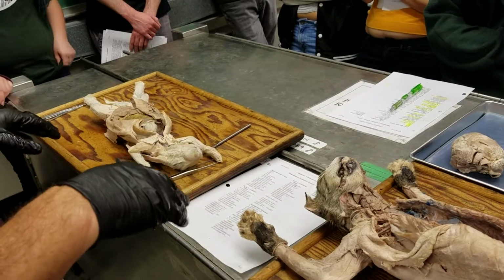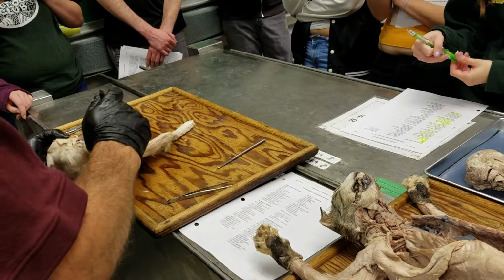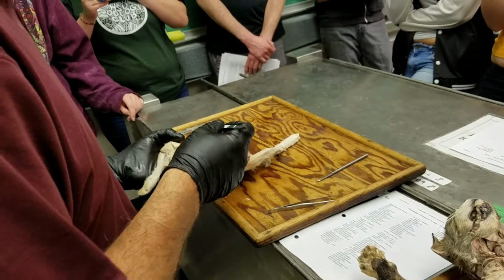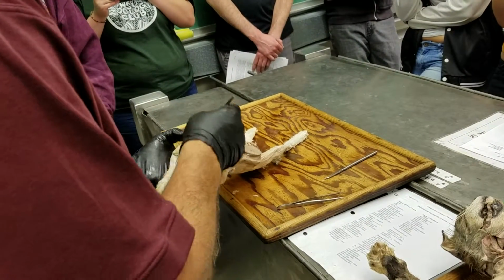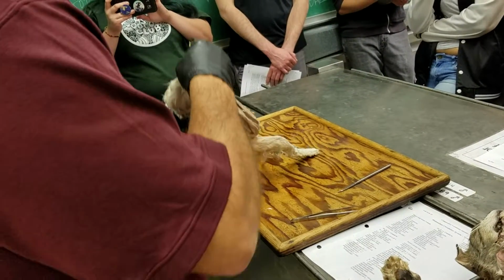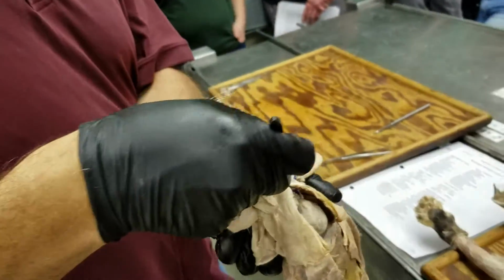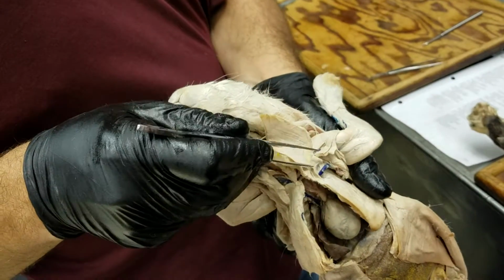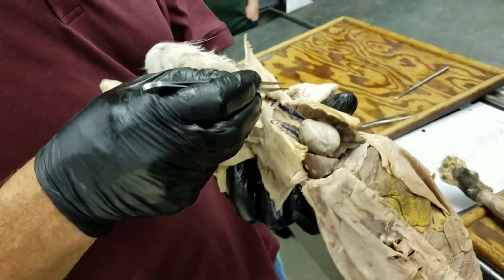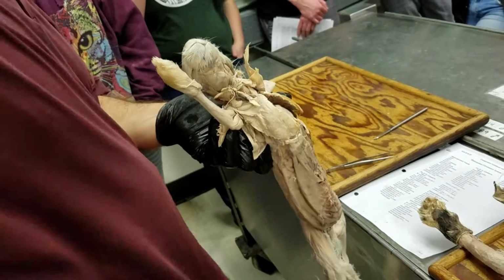Then we get to the actual vessels. Cranial to the heart, we have the right and left cranial vena cava in the rabbit. There's vessels that come in from the limbs, and those are the subclavian veins. And that's this critter here that you can see, nicely injected coming from the forelimb. And technically, where I'm pointing at it here, this is not actually the subclavian vein, but is actually the axillary vein. The axillary vein is the name that it gets in the armpit. The armpit is the axilla.